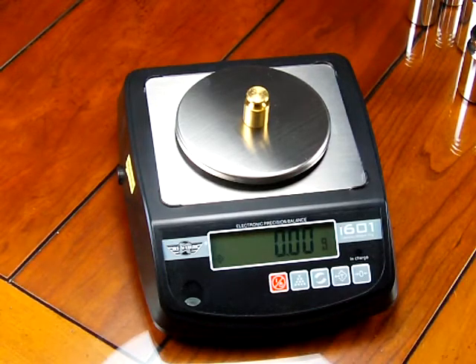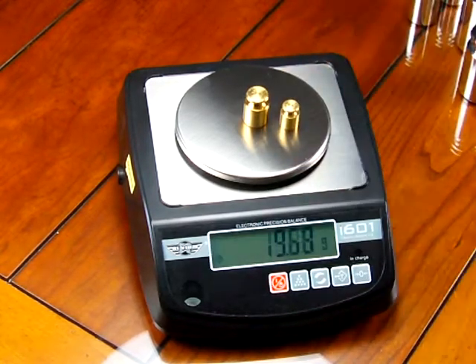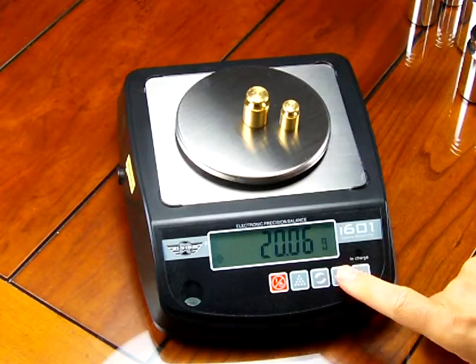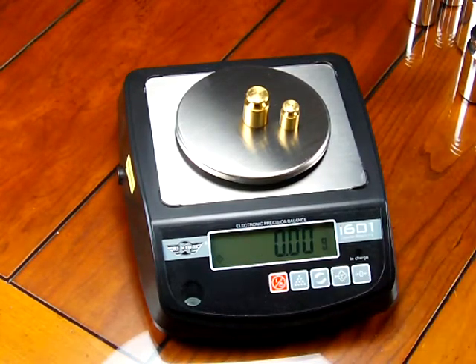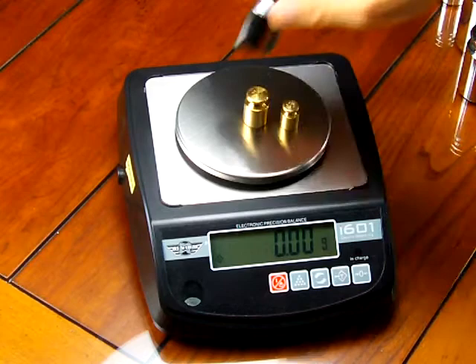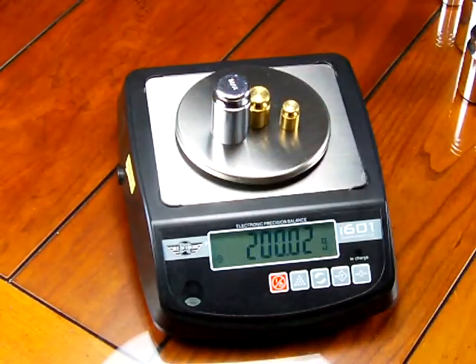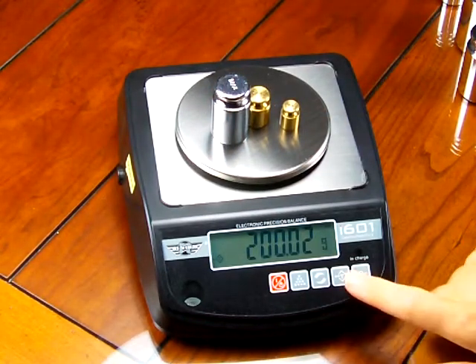That button tares it. So I can tare it. I can put on another weight. I could tare that out. Just have to hold down the button. If I put 200, I can tare that out.